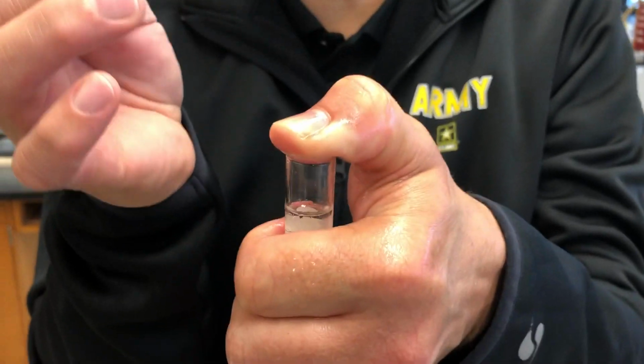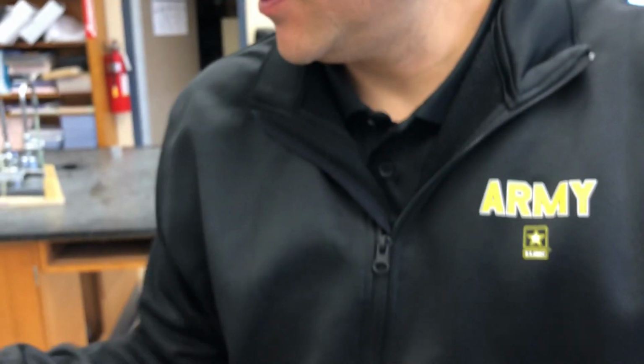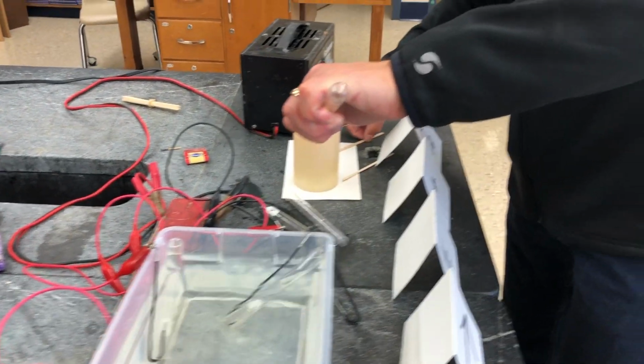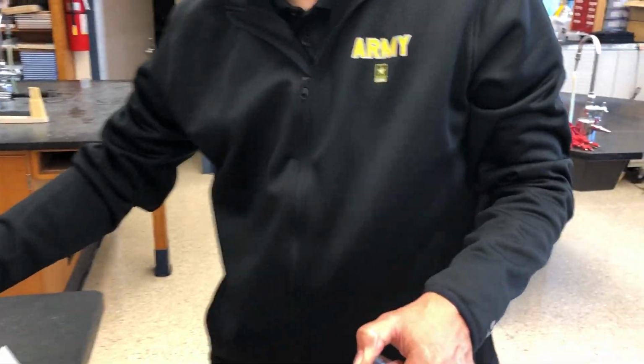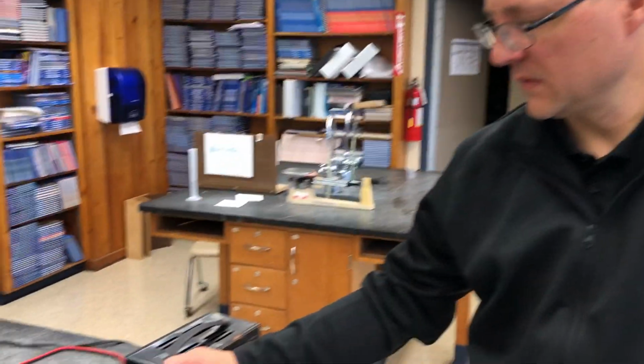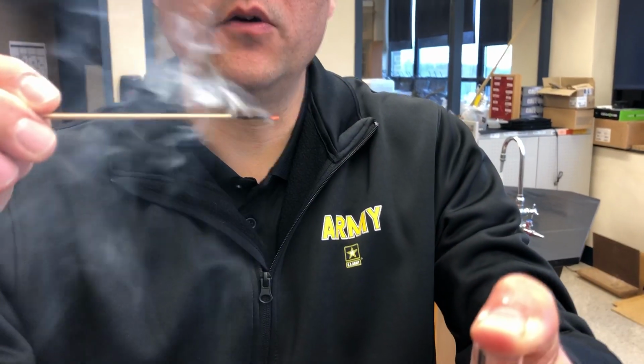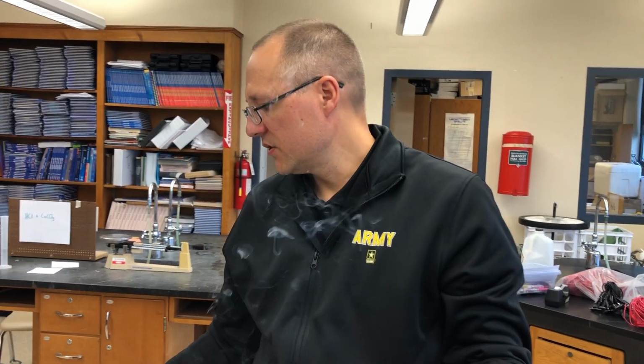Now, we only have so much oxygen here. We'll see how that works out. So there I blew it out. It's glowing. See how it brightens up a little bit? Now, that one doesn't show quite as well as the other one. So I'm going to try it one more time with another one of these test tubes. All right, blow it out. It's glowing. And there we go. We relit the splint. That's a positive test for oxygen. So that is the 3 parts of the Energy Reactions Lab.